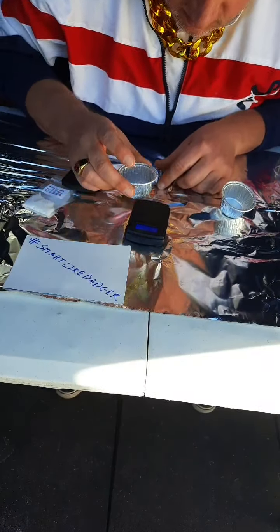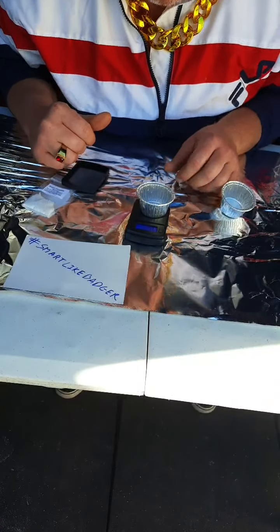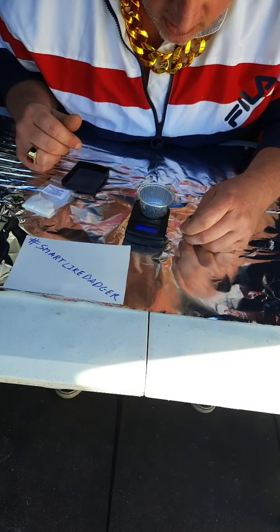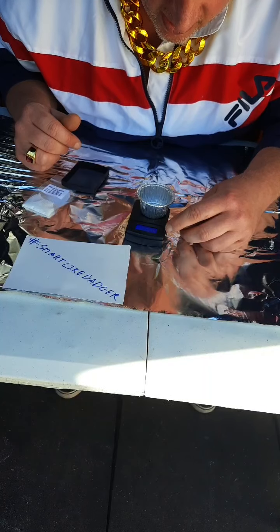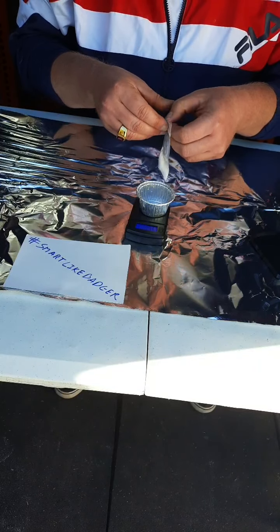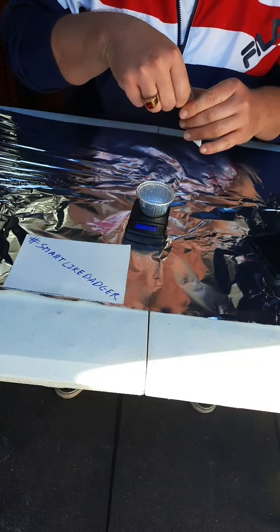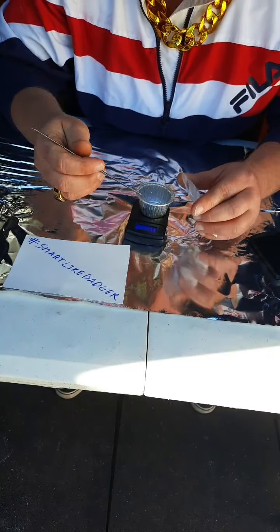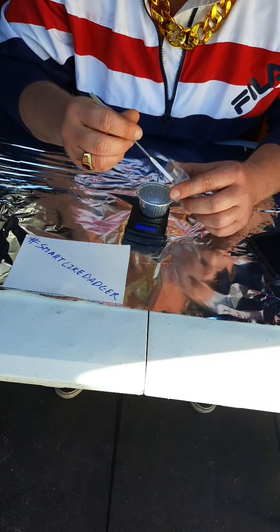Let me see if you can read this. So the cup weighs 2.3 grams, but I don't care. Boris don't care about how much these little cup weigh. So we hit the tare function, T-A-R-E, the tare function, and it says 0.0 grams. We only need about 2 grams. So Boris takes spatula.